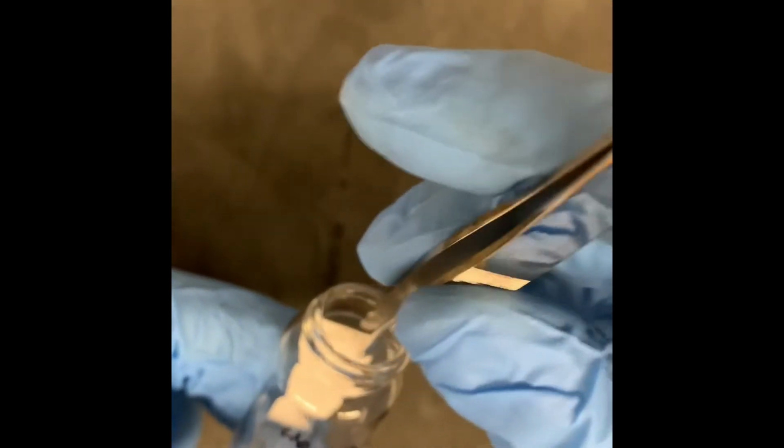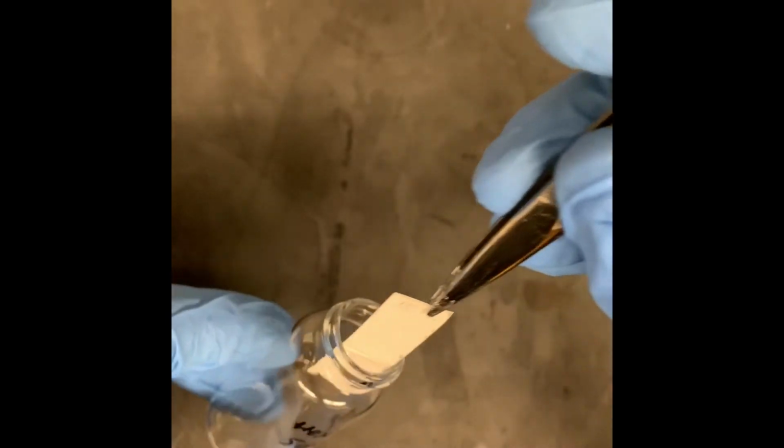All right, so once the solvent level gets very close to the top of the TLC plate, we want to remove it from the solution and then very quickly mark how far the solvent traveled up the TLC plate with a pencil. And then annotate at the top the solvent ratio that was contained in the solvent chamber. And so now what we want to do is see how far up the TLC plate our different spots ran.